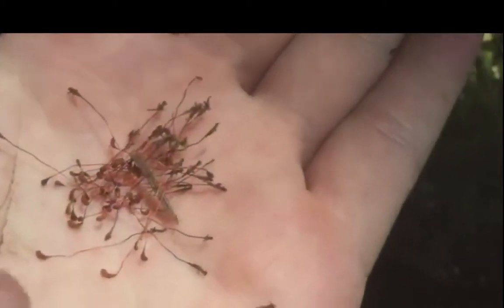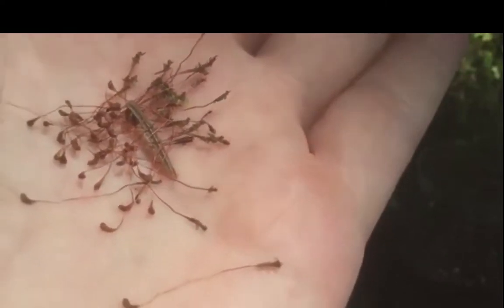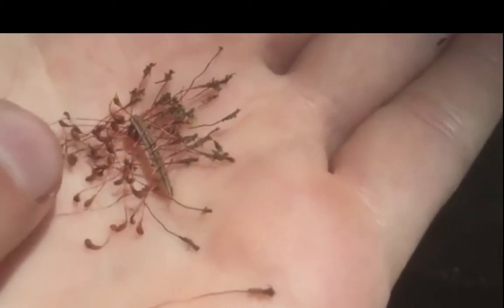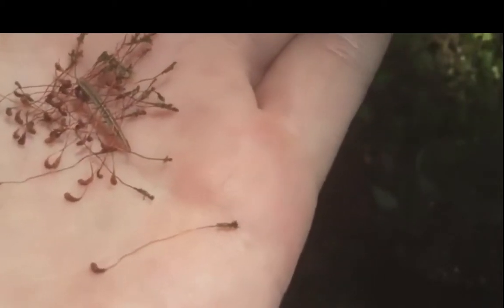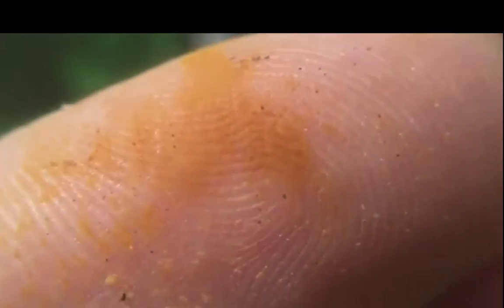I do want to be careful not to introduce too much moss. That can get rehydrated and might give us a false positive. So I want to try and stick to just the spore heads. And we can actually break these apart and kind of sprinkle them like dust. They just look like dust. They are absolutely minuscule. So there's probably a million on my finger right now.